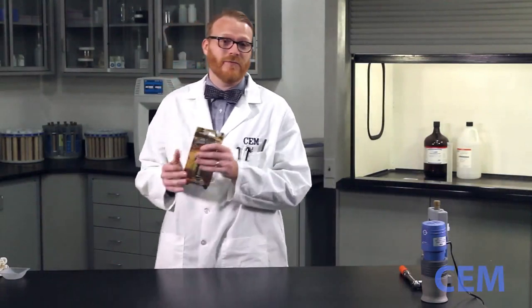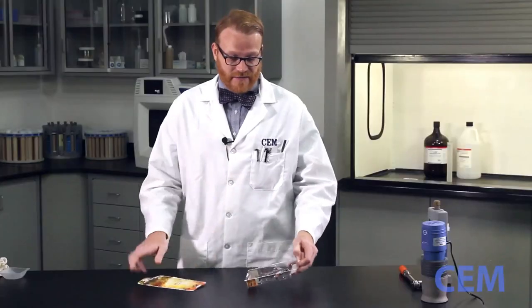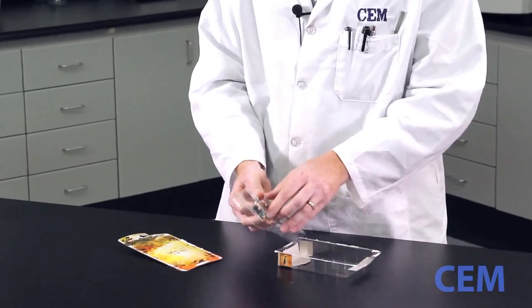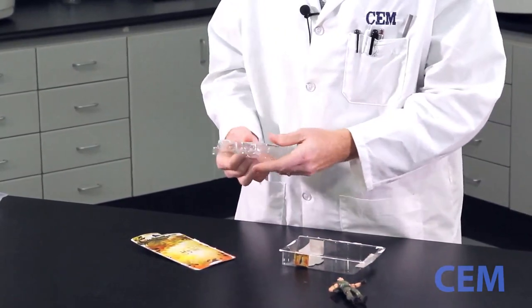And I happen to have one right here. What we're going to do is open this package up and digest this guy. Let's see what we've got. We've got the little man and some weapons.